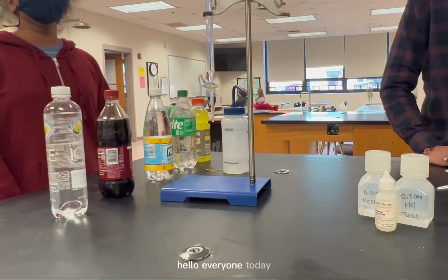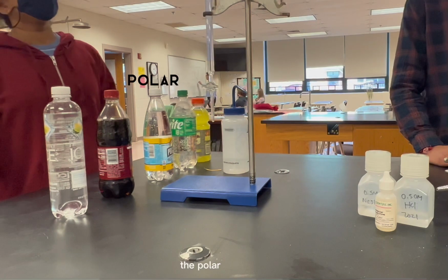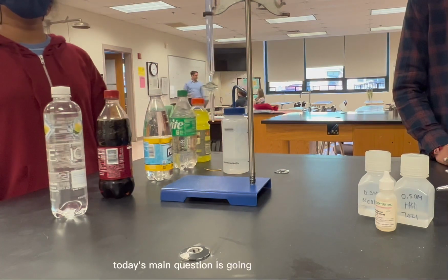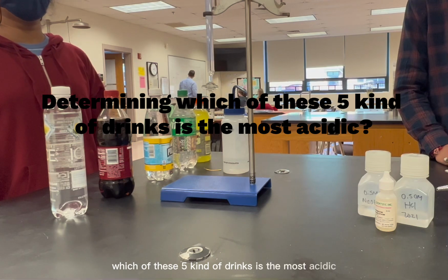Hello everyone. Today we're gonna be looking at 5 different kinds of drinks: the Polar, the Sprite, the Gatorade, the Sparkling Ice, and the Dr. Pepper. Today's main question is going to be determining which of these 5 kinds of drinks is the most acidic.